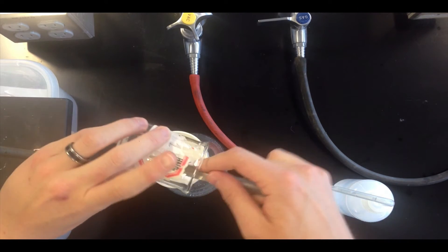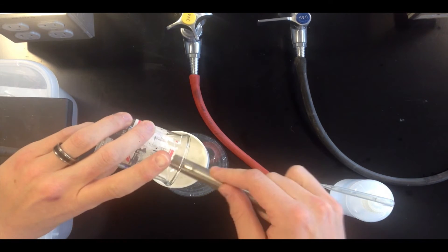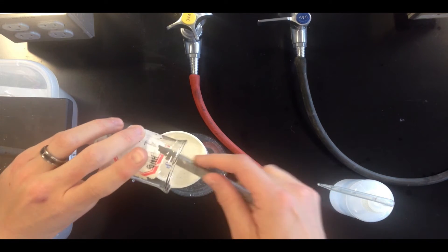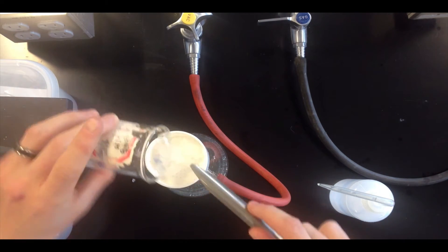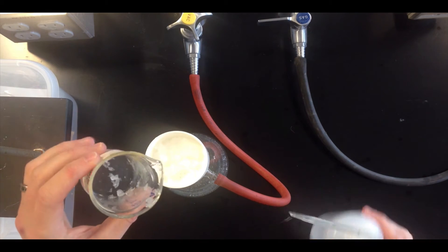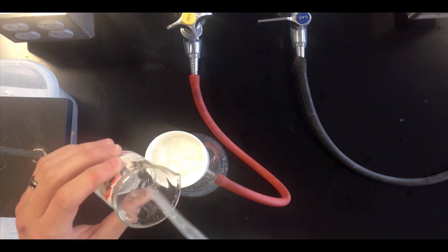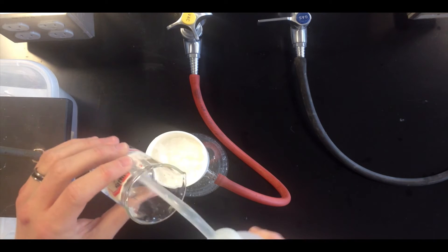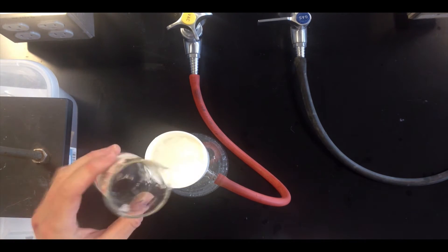In many cases, you'll want to wash these crystals with additional solvents, so it might be water, it might be another solvent. When you go to wash the crystals, it's a good idea to pour the washings into your beaker first, and then transfer those washings into the filter.